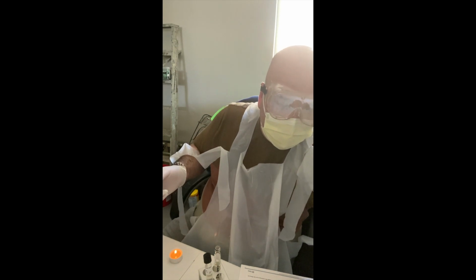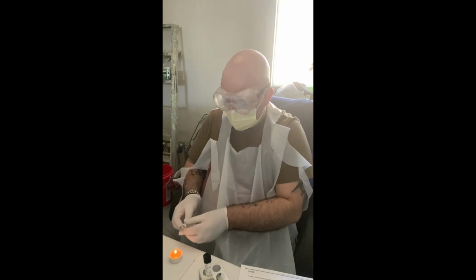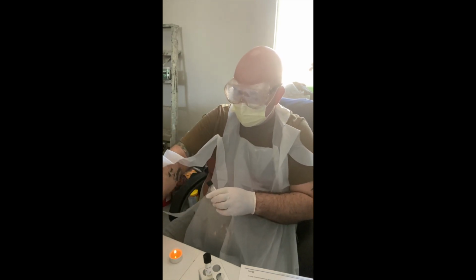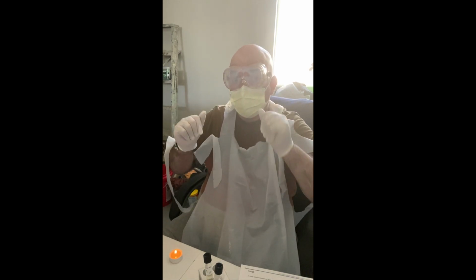And then into bleach that will go. And we're going to flame this again. Okay, lid on, and that's it. So these will sit for 2 days, and then we'll reconvene after that.